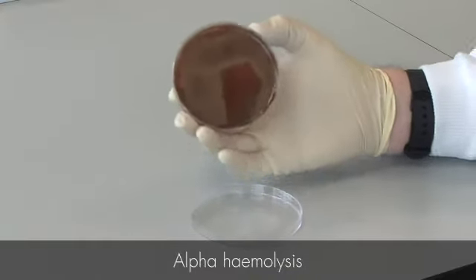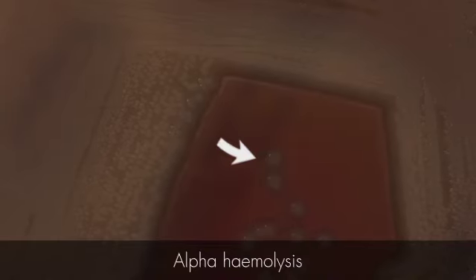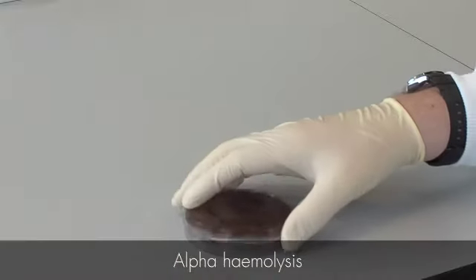On blood agar, you may also see bacterial colonies which appear green. This is known as alpha-hemolysis. In this case, the hemolytic activity present in the bacteria is less efficient, and so the hemolysis seen is incomplete. The area around the cells appears green, indicating incomplete or partial lysis of the sheep red blood cells around the colony. This effect is typically seen in the viridans group of Streptococci, and the major pathogen Streptococcus pneumoniae also shows alpha-hemolytic activity.